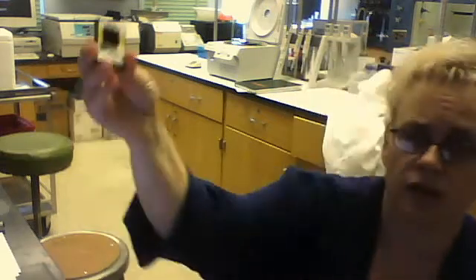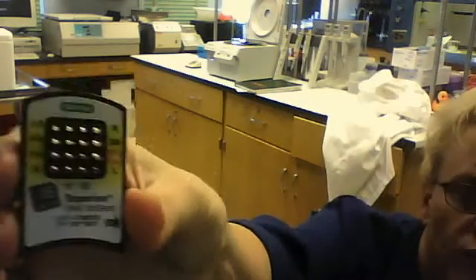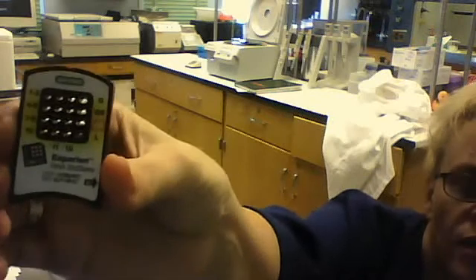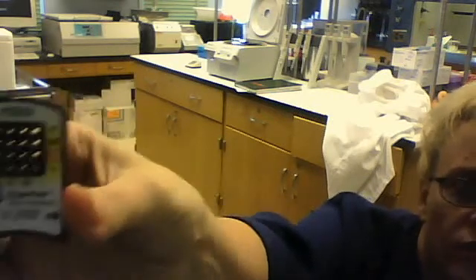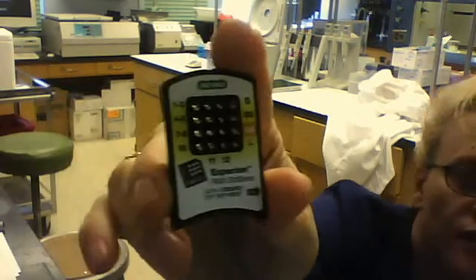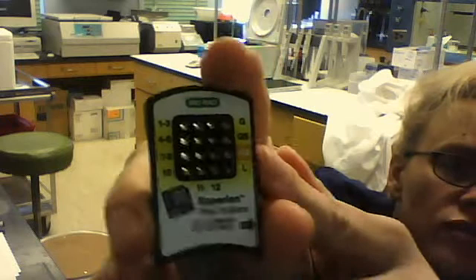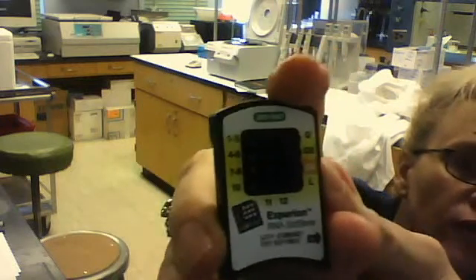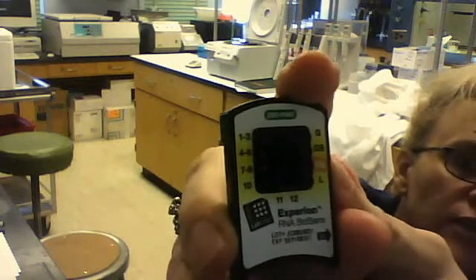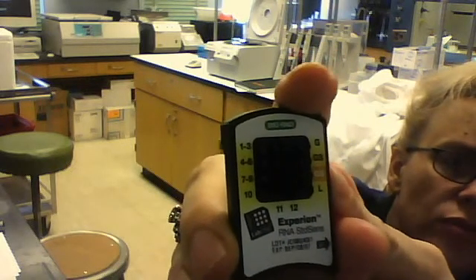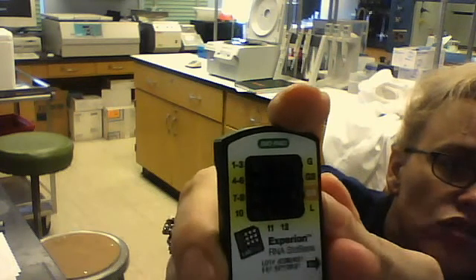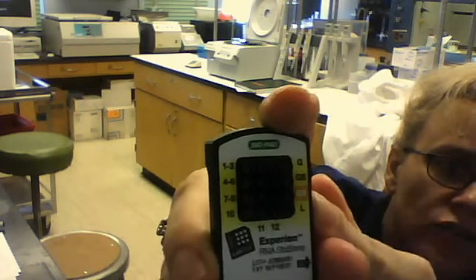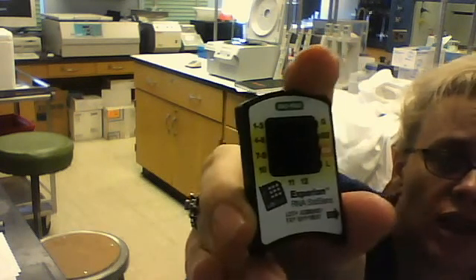So take a good look at this chip. This chip has labels on this side. These GS labels right there. The one that has the orange box is the one you want to pipette nine microliters of stained gel into.